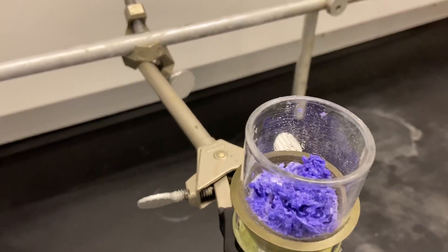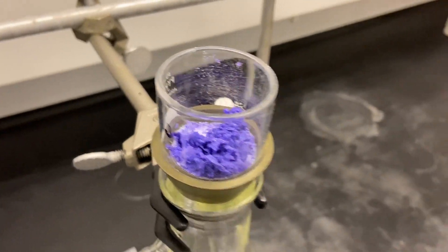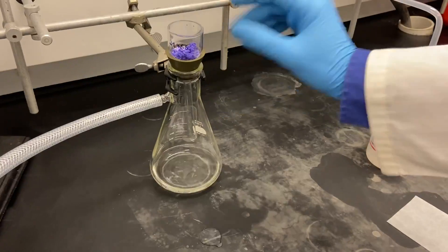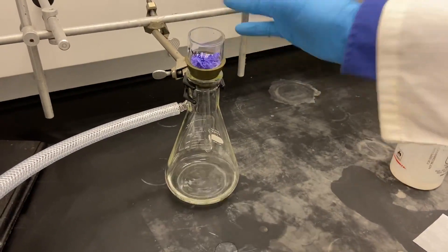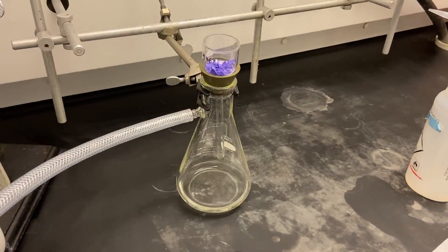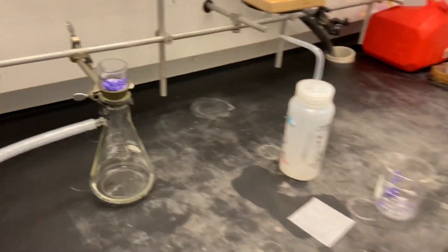Just pulling solvent through this will also dry it a little bit. When you are happy with the dryness, you can even put it in a vacuum desiccator. And this is how you use a frit filter for your separation.